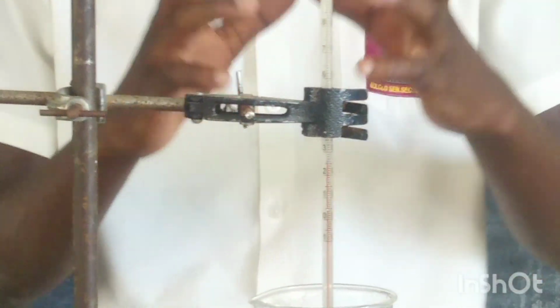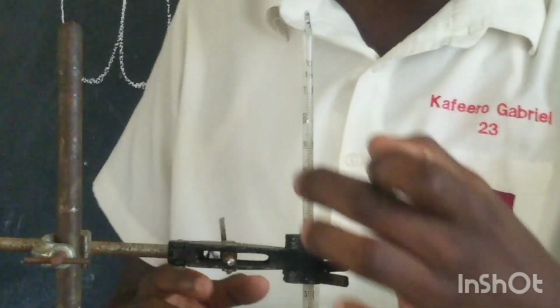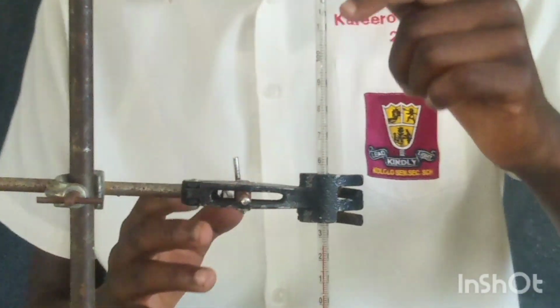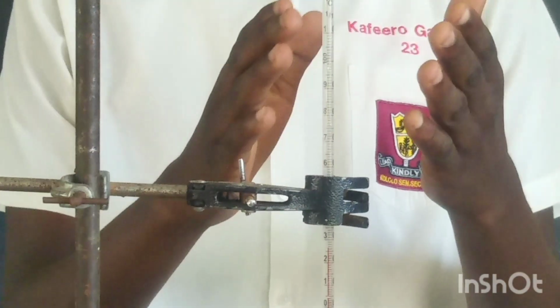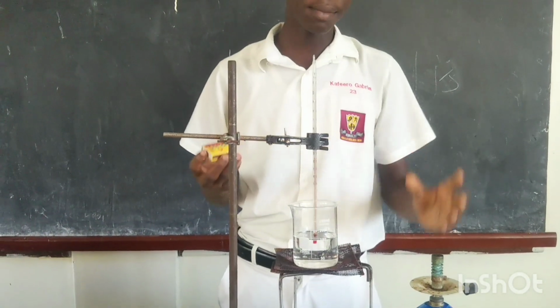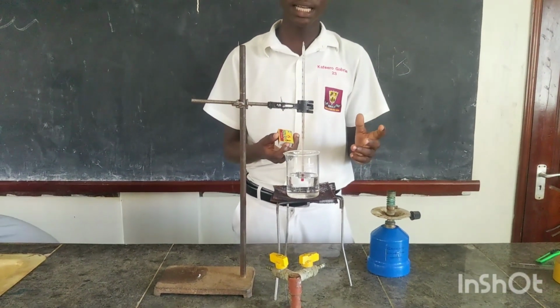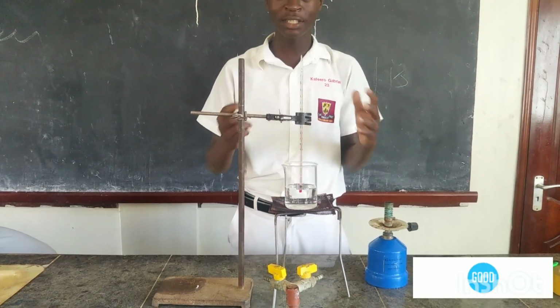or to determine the accurate boiling point of water, because it's labeled. It has some measurements, as you see, from 0 to 100 degrees Celsius. I have my retort stand here that's holding my thermometer. I also have a matchbox that will provide some source of heat to the burner. So as I begin, I need to first light my burner and place it below the tripod stand such that the water begins to heat.